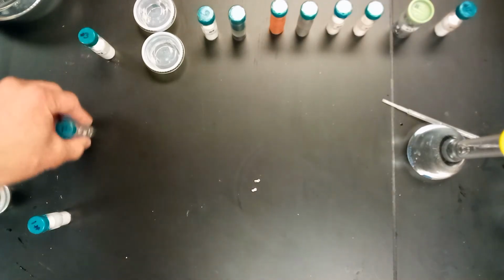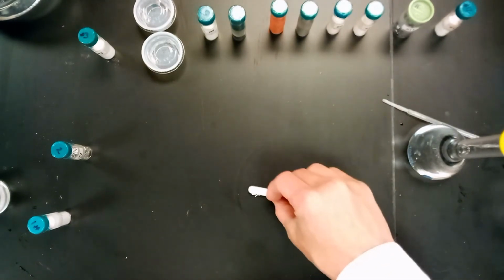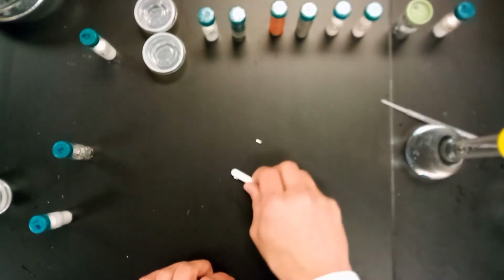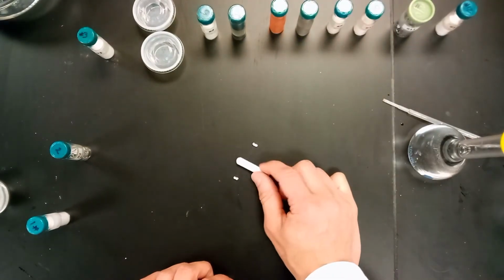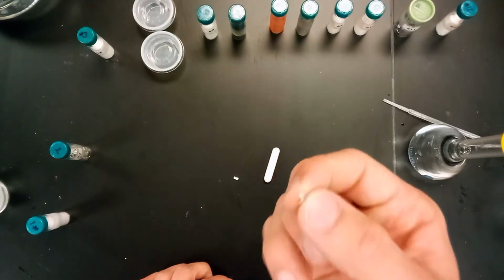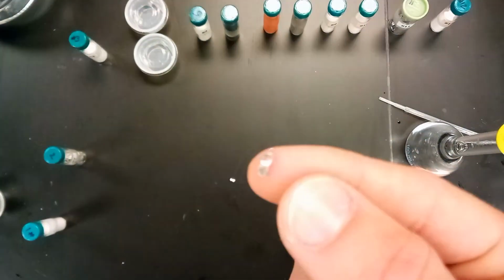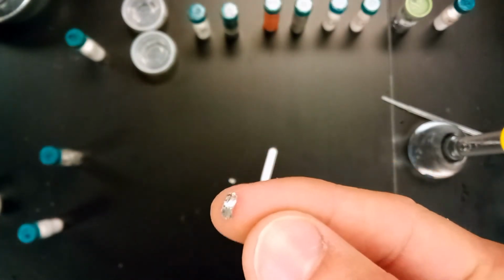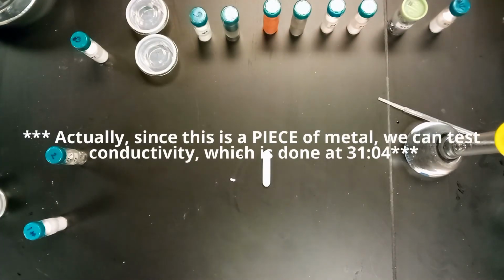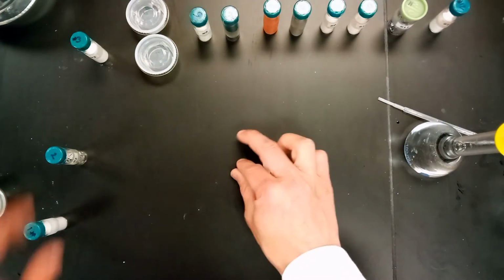First thing that we really want to do with metals to test if they're magnetic or not, we have just a magnet. This is actually one of the stirring things from like the titrations. This metal is not magnetic, which tells you something. Also looking at it, it's just a small little piece. But yeah, so it's not magnetic. There's not really a whole lot else we can do with metal with our current situation. It's not magnetic is really the big takeaway.